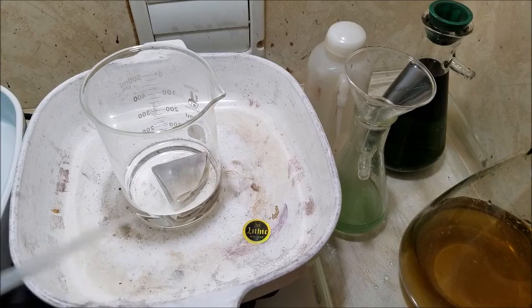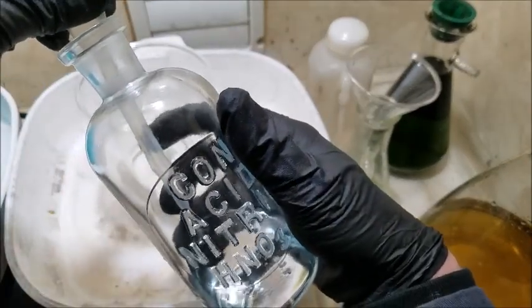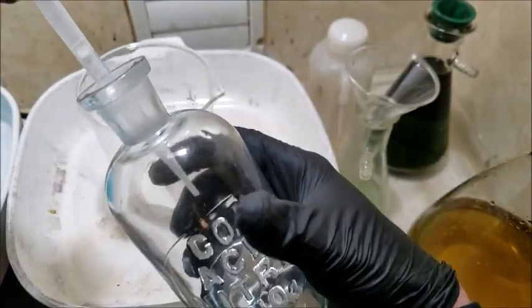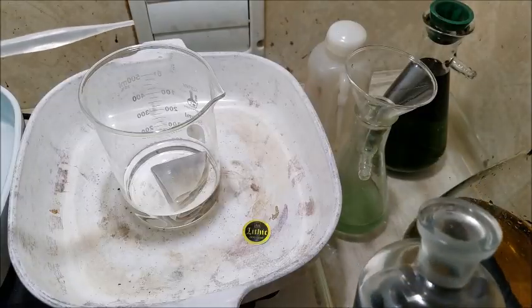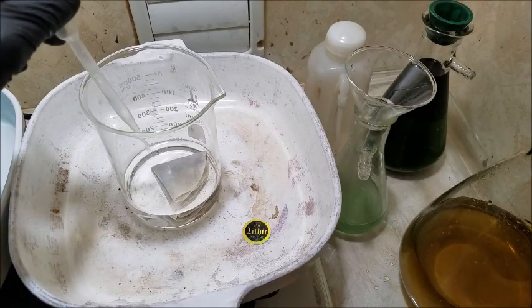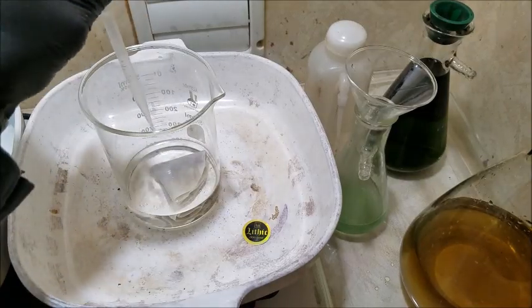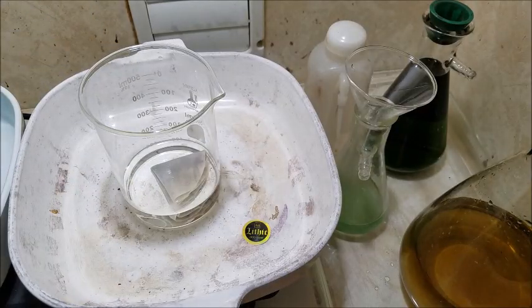It's not hot yet, so it'll take a little bit to warm up, but within 30 seconds, if this is precipitated powdered gold, we should see a reaction pretty quick, and it should be a nice clean yellow, not crappy brownish, blackish, greenish solutions like we had. So let's just put some drops in here. I got 2 mils loaded in here. I'm just going to start with that. Let's just see what happens. I'm not going to even stir it around.